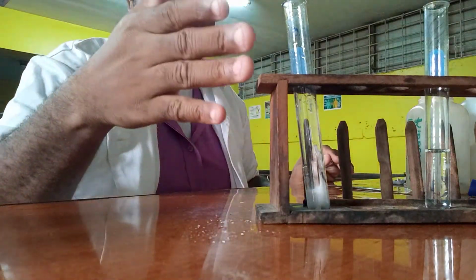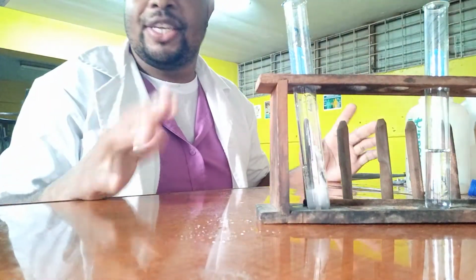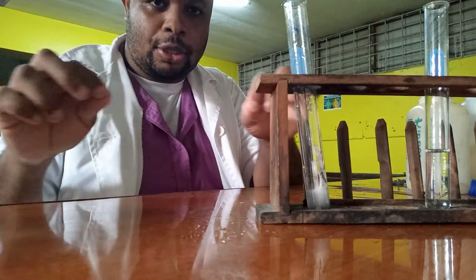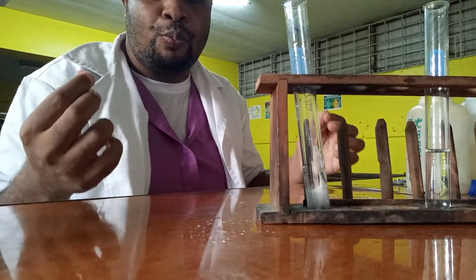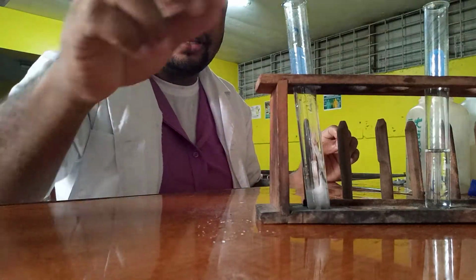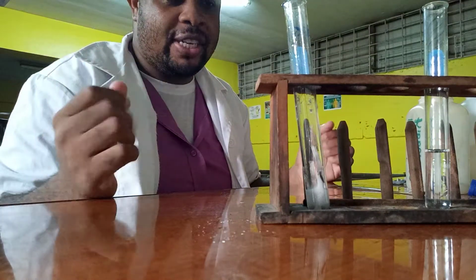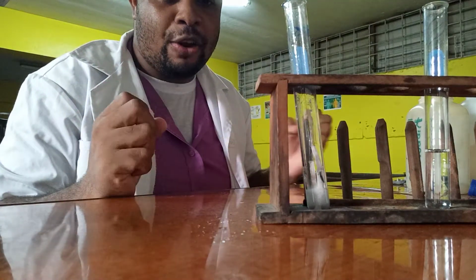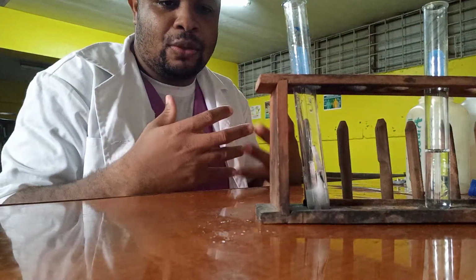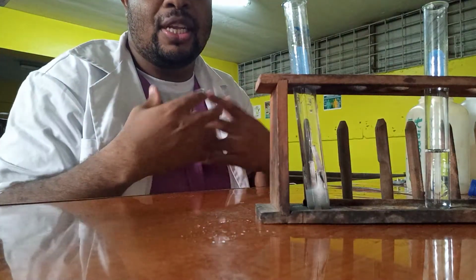So when metals react with acid, we get salt and hydrogen gas. We test for the hydrogen gas by using a wooden splint, a piece of stick. As I hope you heard, it went out with a popping sound. So effervescence occurred, because it was very vigorous. When the reaction is vigorous, we say effervescence took place. Once you see bubbles being produced, that's a sign of a gas.